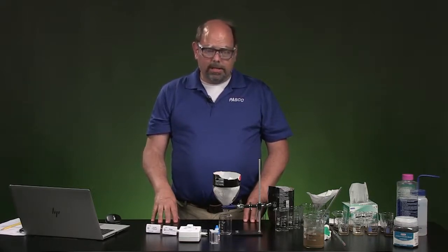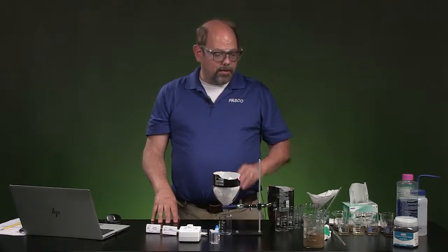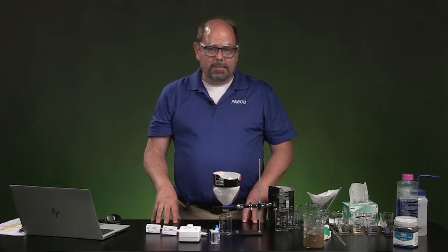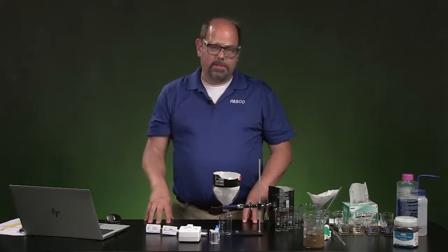So we're going to get started here, and we're going to talk about how we start from some water source and try to make it as clean as possible, and you're going to try different kinds of methods to do that.